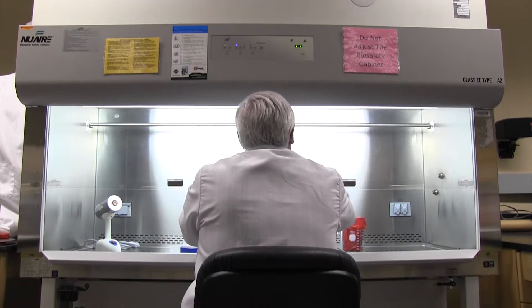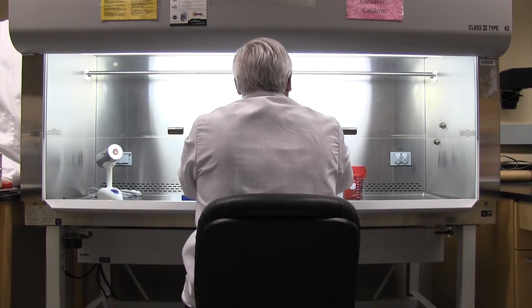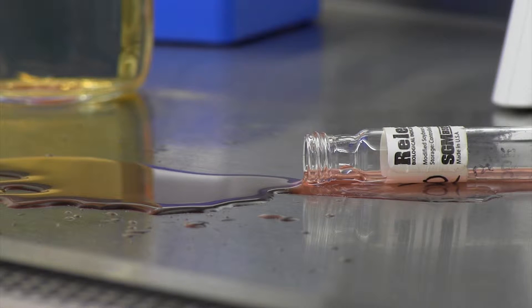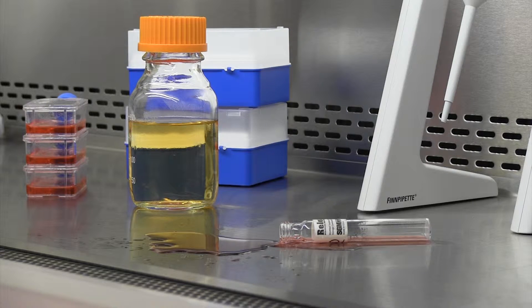This video shows the proper steps to clean up a spill in a biosafety cabinet. A spill is considered small when it does not create major splashing and does not splash into the front or rear grills of the biosafety cabinet.